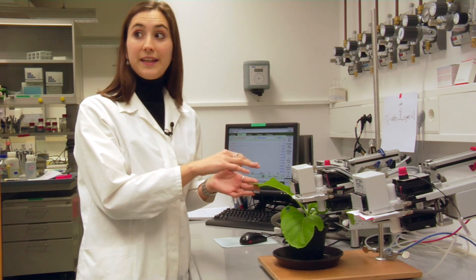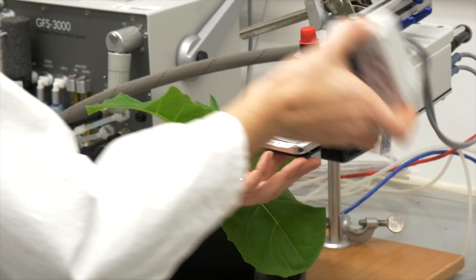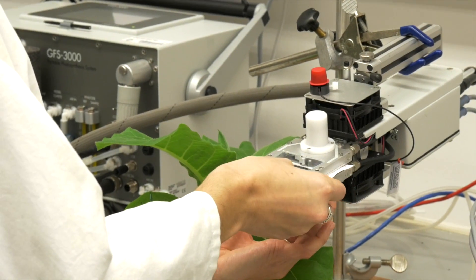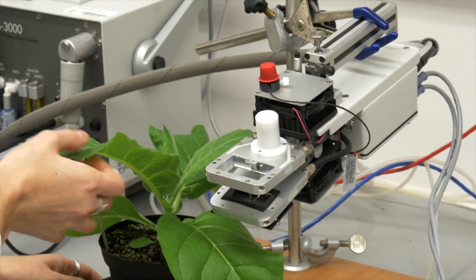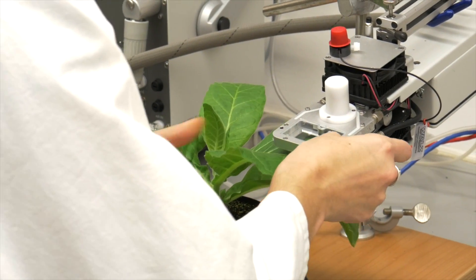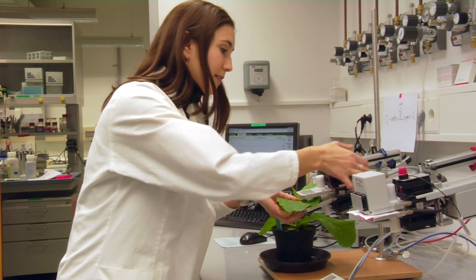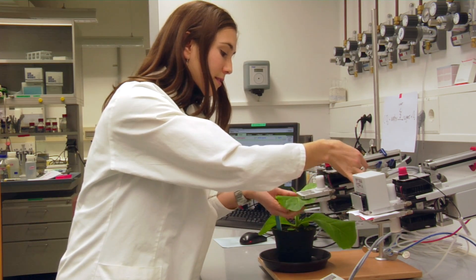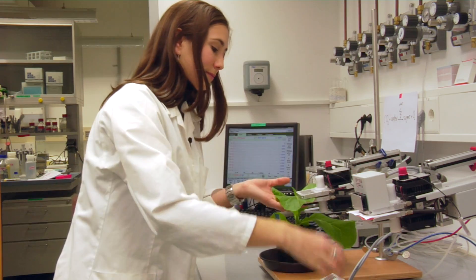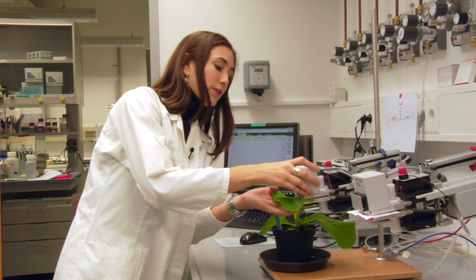Gas exchange occurs in the leaves, so I'm going to introduce the leaf in the chamber. It's important not to fold it.